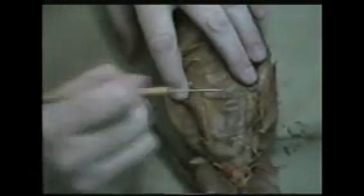The word transverse means the fibers are running horizontally. So we have a vertical set — rectus abdominis. We have an oblique set on the outside — the external obliques. We have an oblique set on the inside — the internal obliques. And then we have the transverse abdominal muscles. And those are the muscles of the mink abdomen.